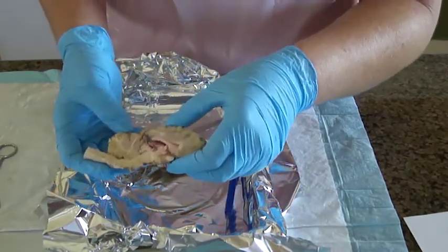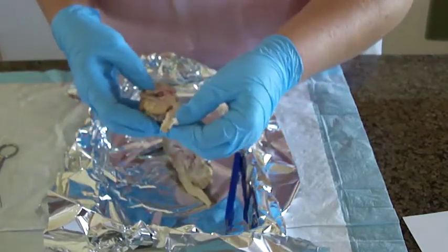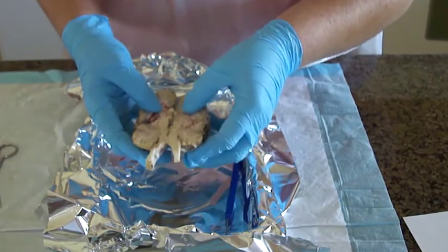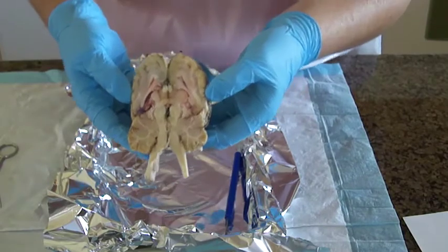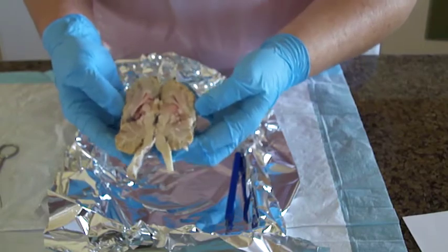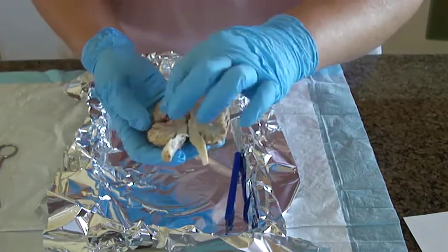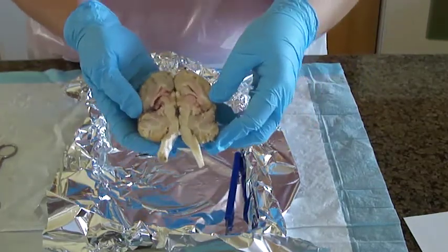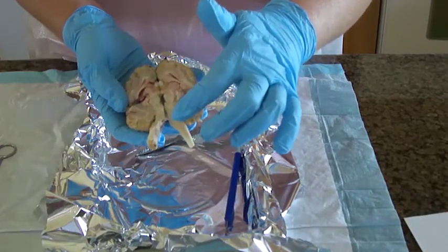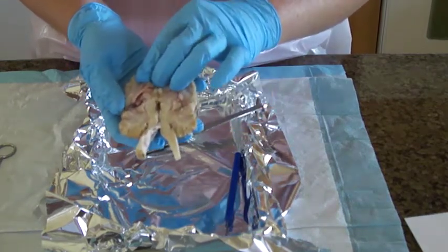Let me see if there was anything else I'm supposed to mention. Oh, I was supposed to cut the spinal cord to look for the butterfly shape. I don't know if I did that right. Let's see. And then of course you can see the central canals that carry all the ventricles, and they carry this cerebrospinal fluid that goes into the continuation of the central canal that carries the fluid through the brain. We already did the thalamus and the hypothalamus.